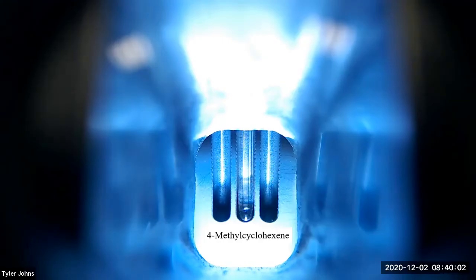We will now perform a micro-scale boiling points determination of the 4-methyl cyclohexene distillate.